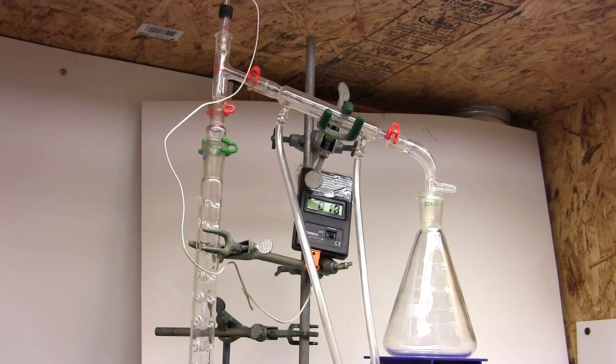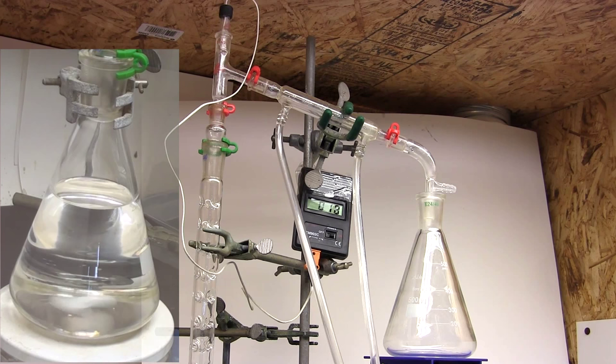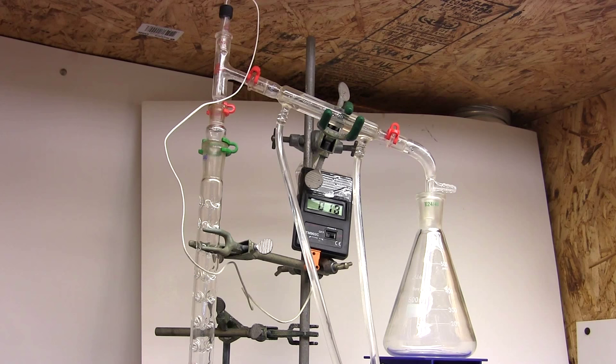So here is our fractional distillation setup. If you want to know how the whole thing is assembled and used you can refer to my previous video on the topic. I've included links in the video description. Okay let's turn on the stirring, the heating and the cooling water.